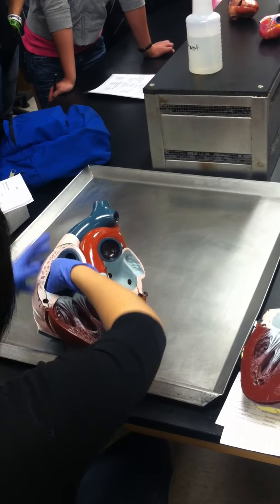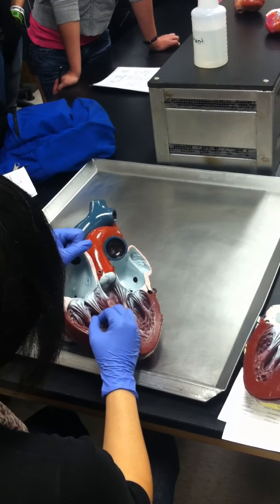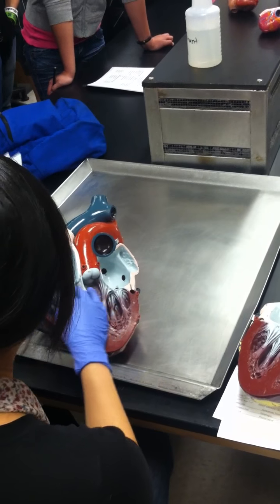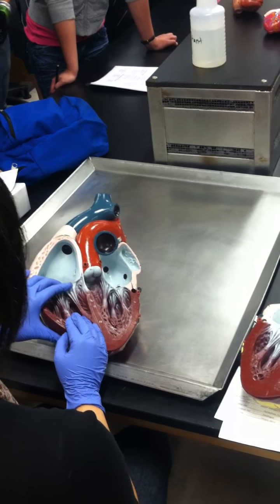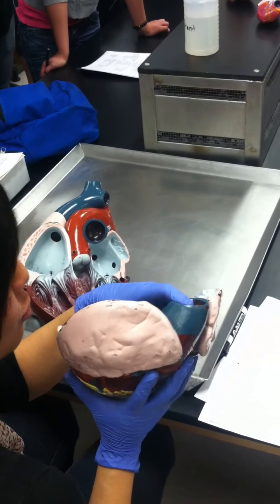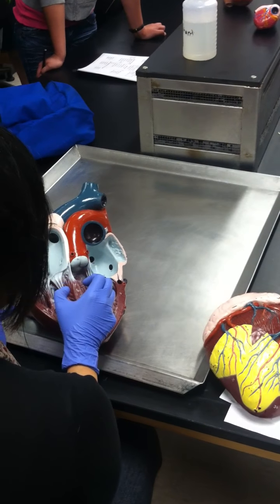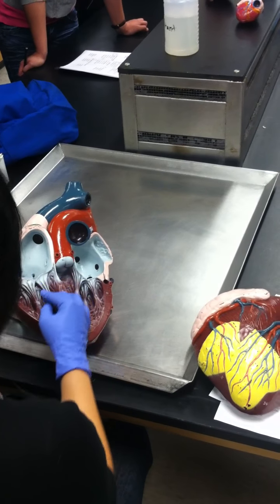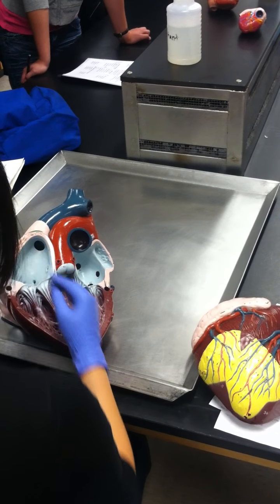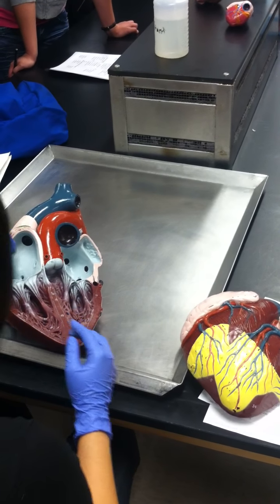Then you have contraction, blood is pushed into the right ventricle. From here, where does the blood have to go? To the lungs, through the pulmonary trunk first. But if we squeeze down to here and we don't have this flap, the flow could go back to the right atrium. We don't want that to happen, we want it to go through.